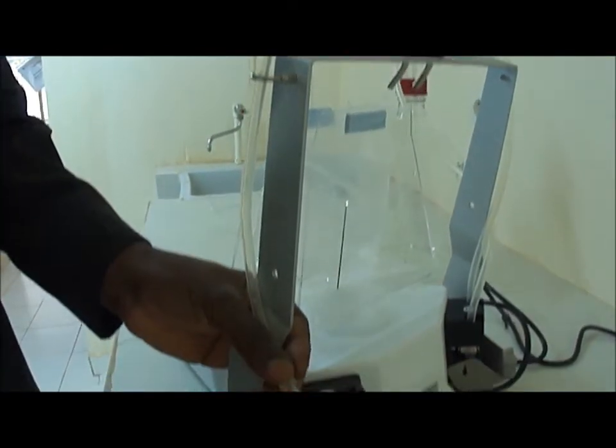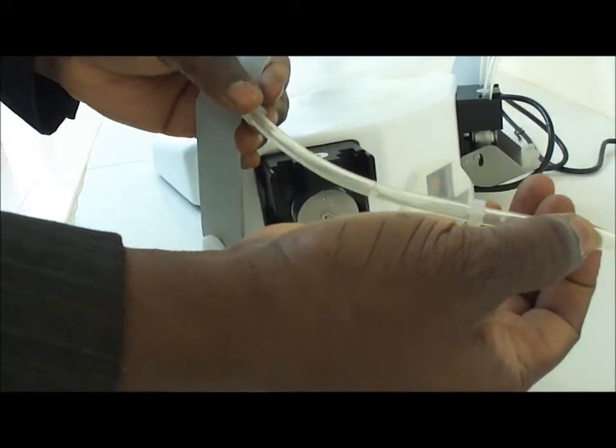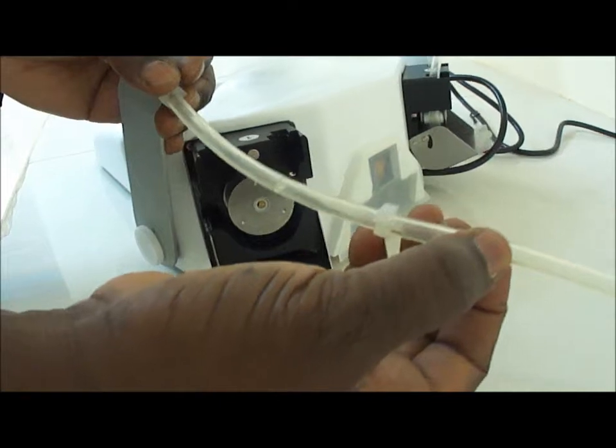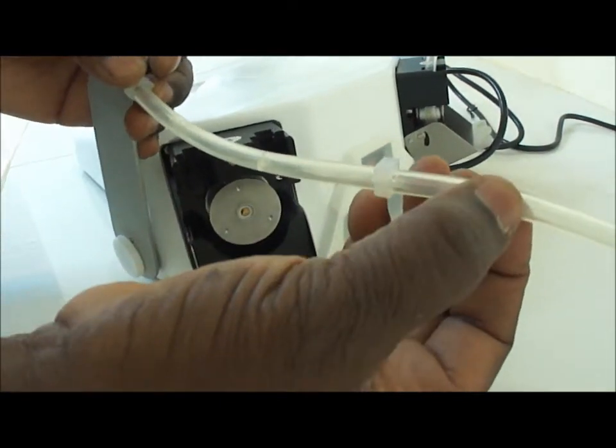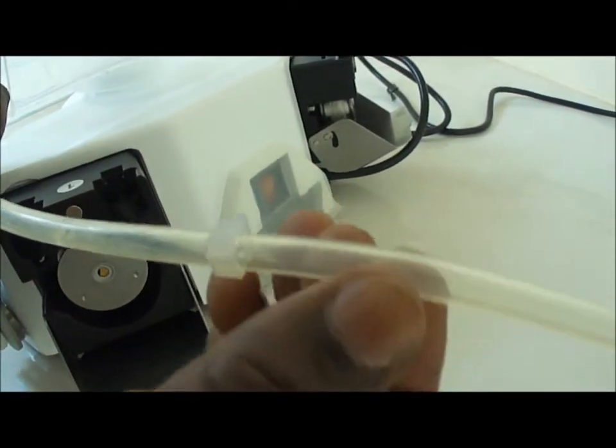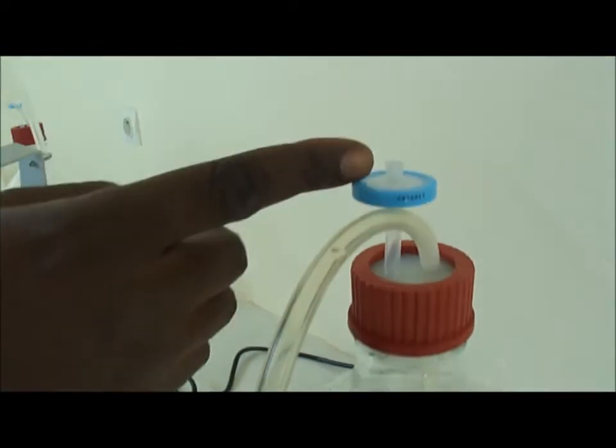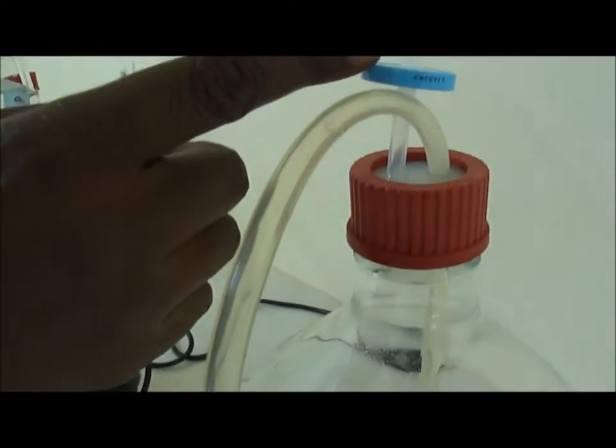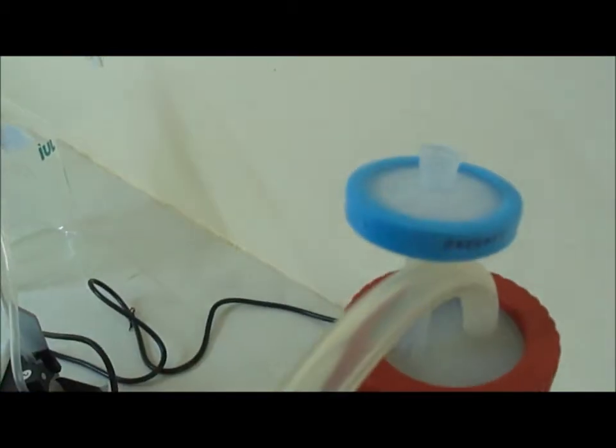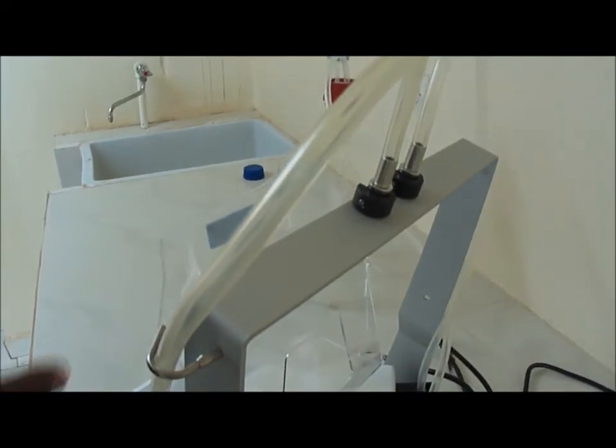It's only by a kind of successive pressure and depressurization of the pipe. So it will push on the outside of the pipe and release it. Push and release. And since atmospheric pressure is coming into the bottle through this small filter, then water is pumped inside and then sent to the bottle.